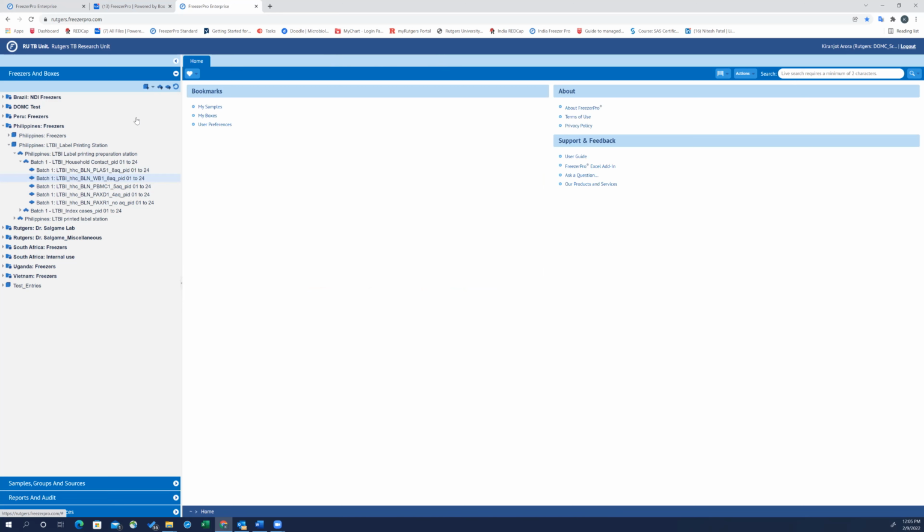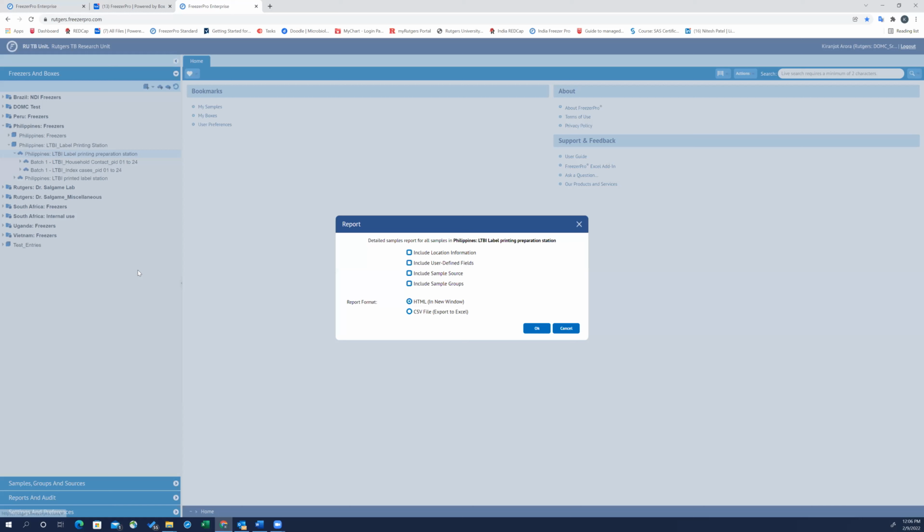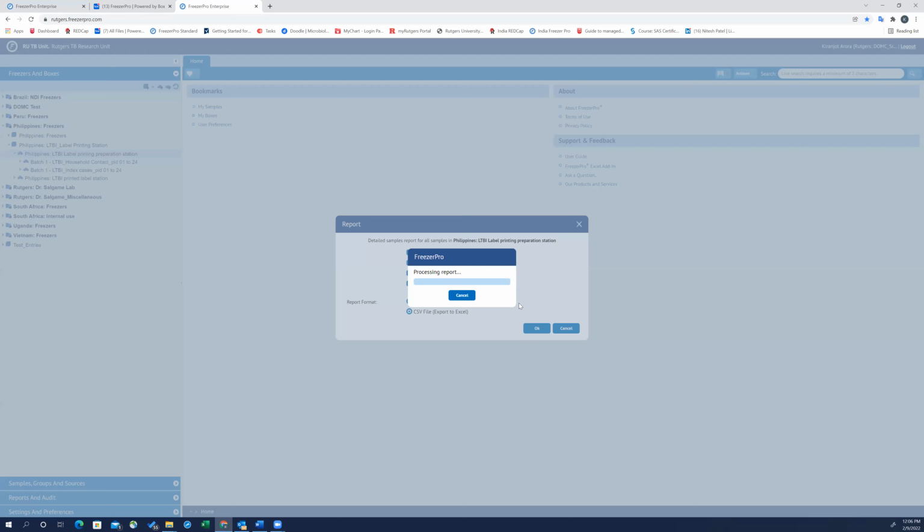So the way that you accomplish this is first, for the label printing preparation station, here are all the samples where I would like to make the changes. I would right click on the subdivision that's nesting all the samples. So the samples are in these ones, but this is the lowest subdivision that's nesting all the samples. And I would click on sample report, include all of this information and download a CSV file. There are a lot of samples, over 1,500 samples. So the report processing will take a minute or so.